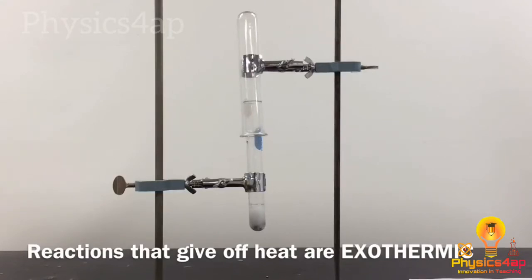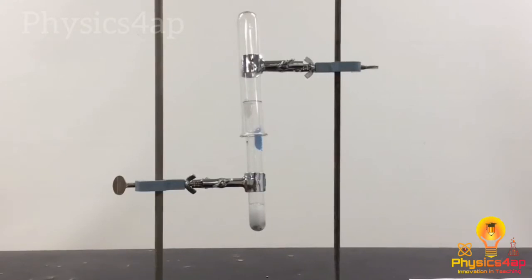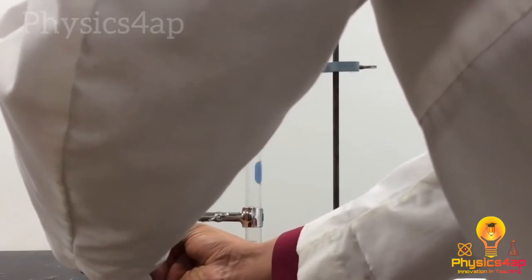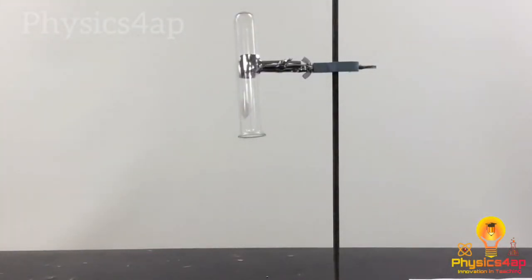So I'm making quite a bit of hydrogen here. All those bubbles of hydrogen are being produced. Now, when I'm satisfied that I've made enough hydrogen gas, and I think I've made quite a bit, I will let this run a little bit longer. I think that's probably good enough. When I'm satisfied that I've made enough hydrogen gas, I'm going to lower this. And we'll come back to that later.